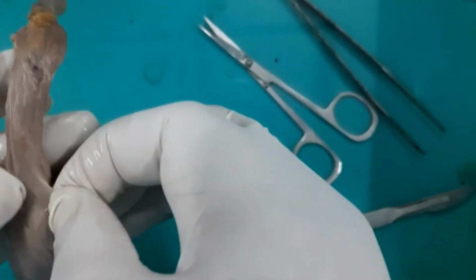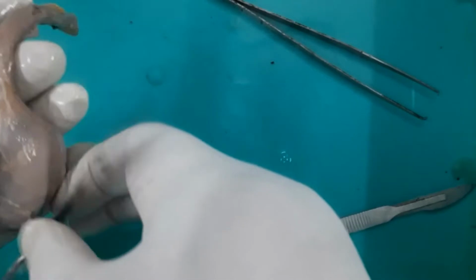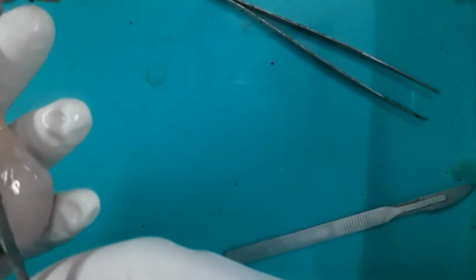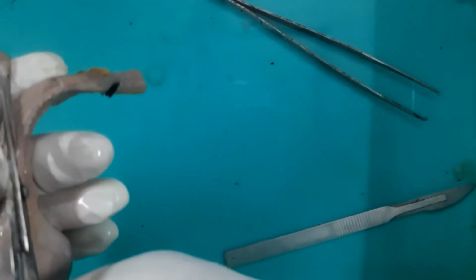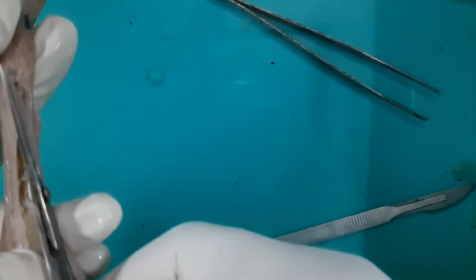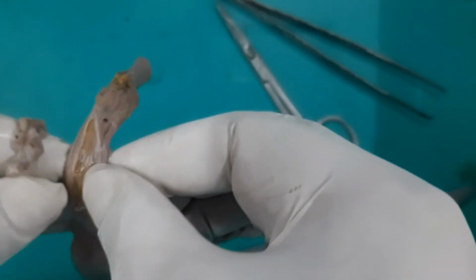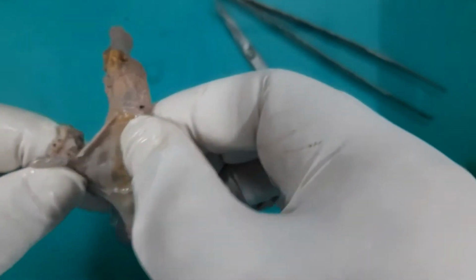From most of the part, the cremasteric muscle and fascia, which is the second layer, will show you the muscular bands or slips, muscular strands, which are coming from the internal oblique muscle. Now I am cutting the cremasteric muscle and its fascia. And then I will show you this cremasteric muscle and fascia, which is covering the spermatic cord, and then it will cover the testes also.